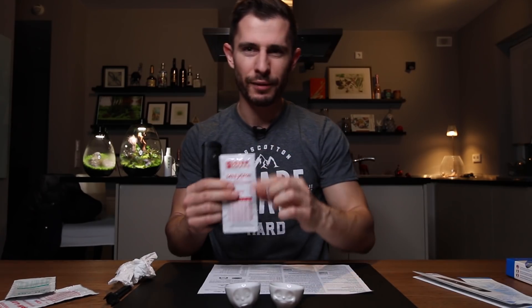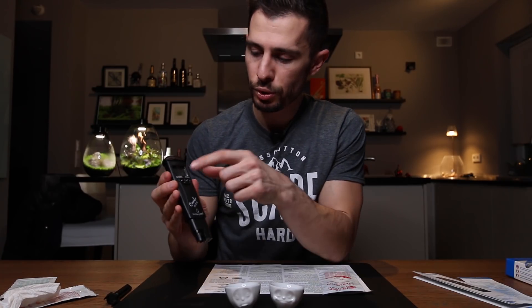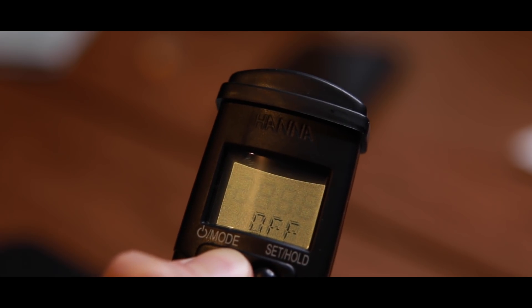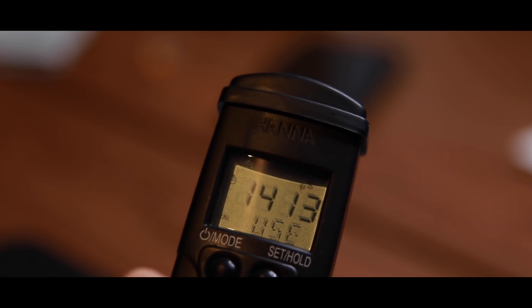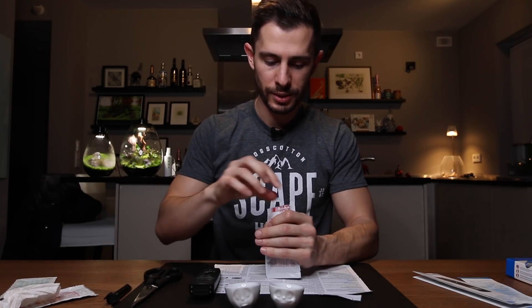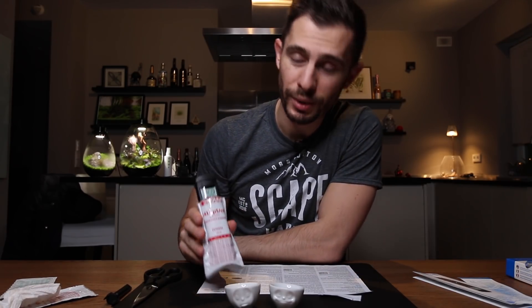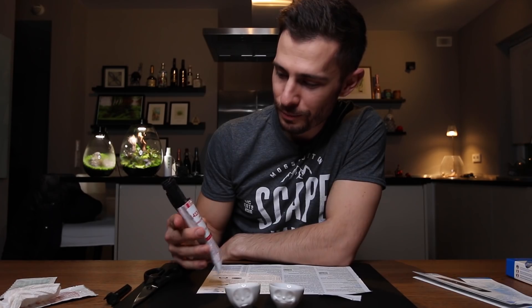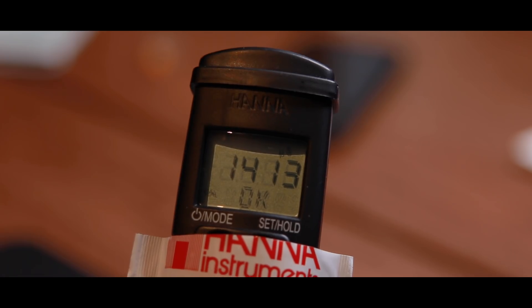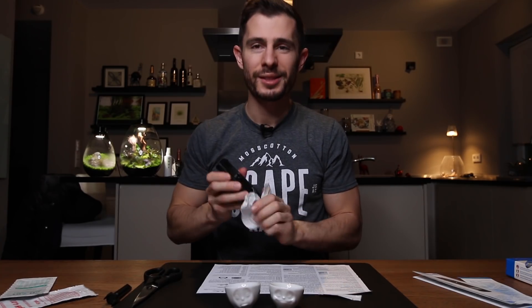Next is to calibrate the conductivity — I still have the solution in this tiny little bag. To calibrate conductivity I have to change to the conductivity mode just by pressing the set button — it shows me the microsiemens. I press the mode button until I see calibrate, and then it says to use the 1413 solution, which is over here. I just use the bag for simplicity and dip it inside — that's how it works, you can simply insert it into the bag, you don't need fancy cups. It's calibrating, the display is blinking. There we have it — a little OK sign, and then it shows the temperature. It has calibrated, and now this device is ready to use.